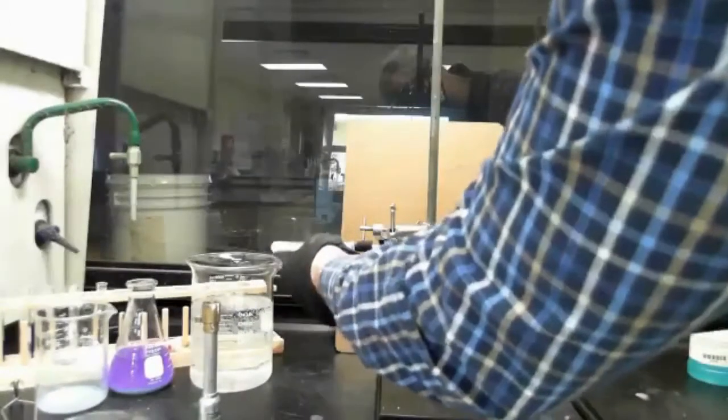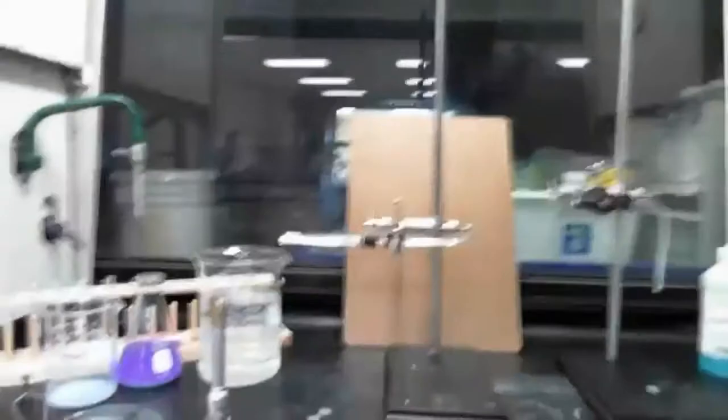And I'm going to put that test tube on there. So that's our apparatus.